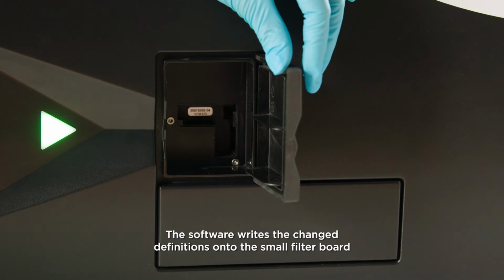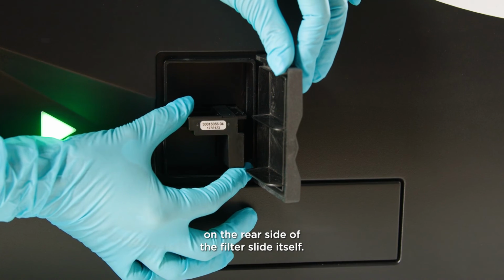The software writes the changed definitions onto the small filter board on the rear side of the filter slide itself.